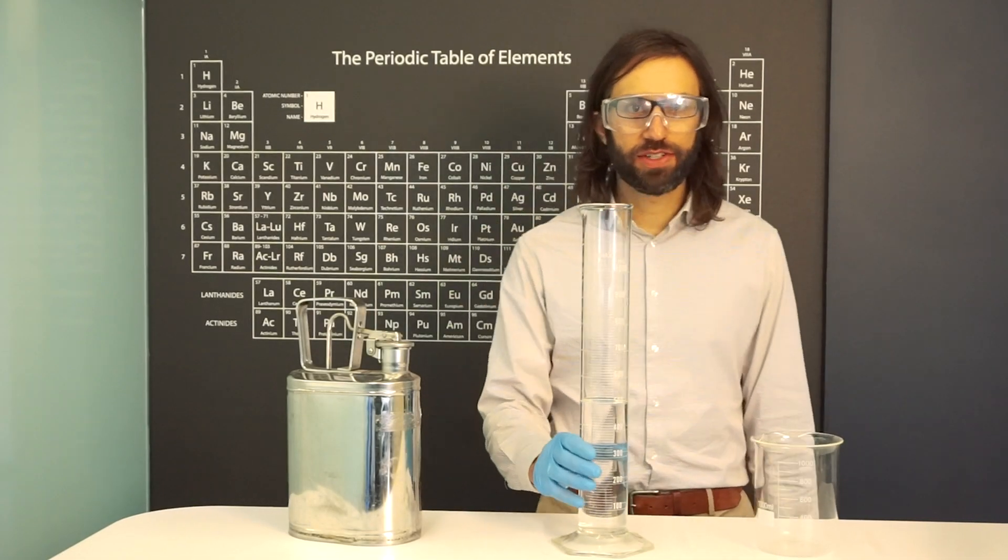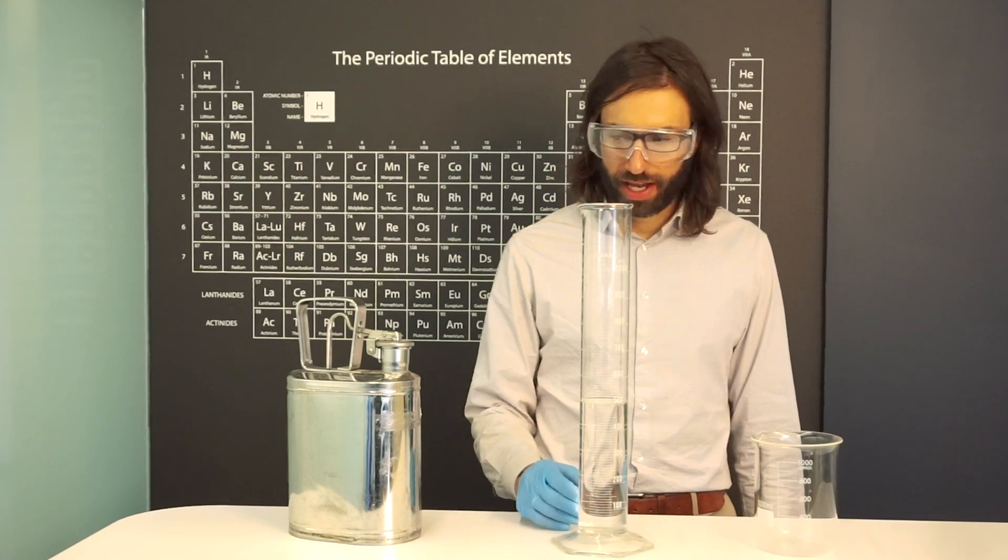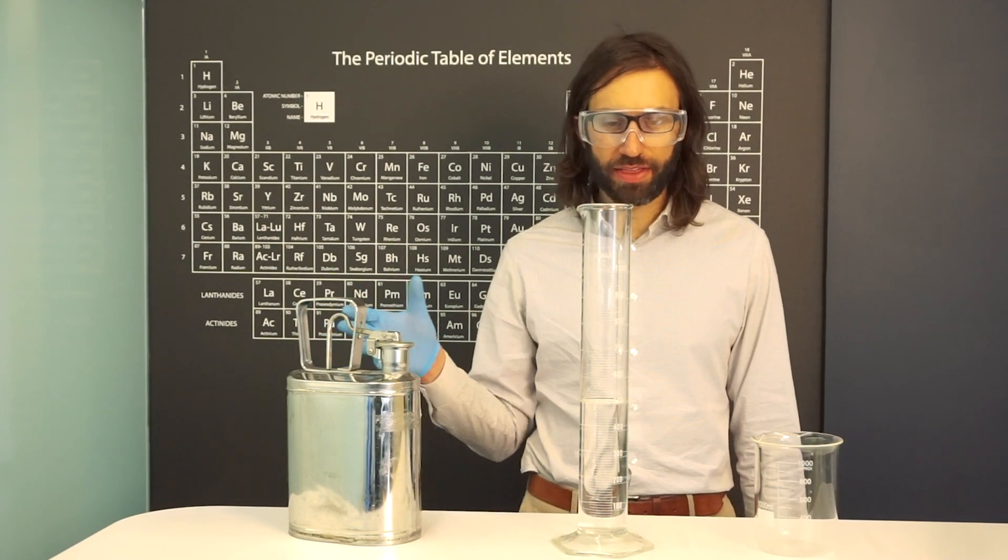So we have here 500 milliliters of just regular distilled water and we're going to see what happens when we mix ethanol with it.